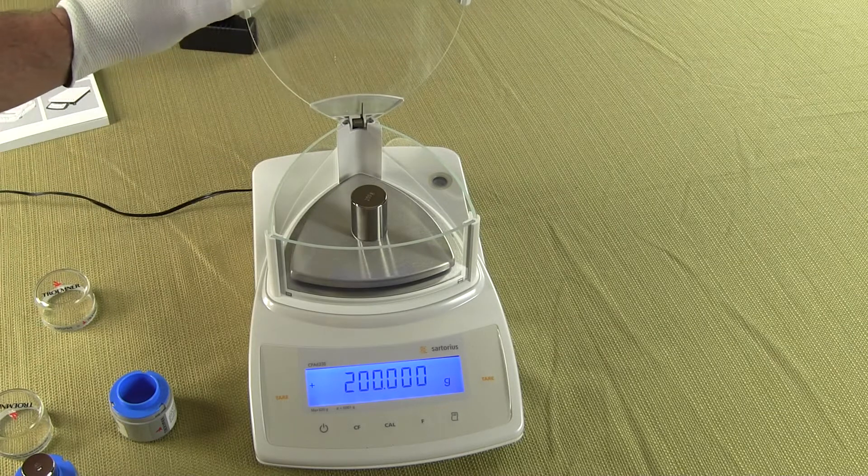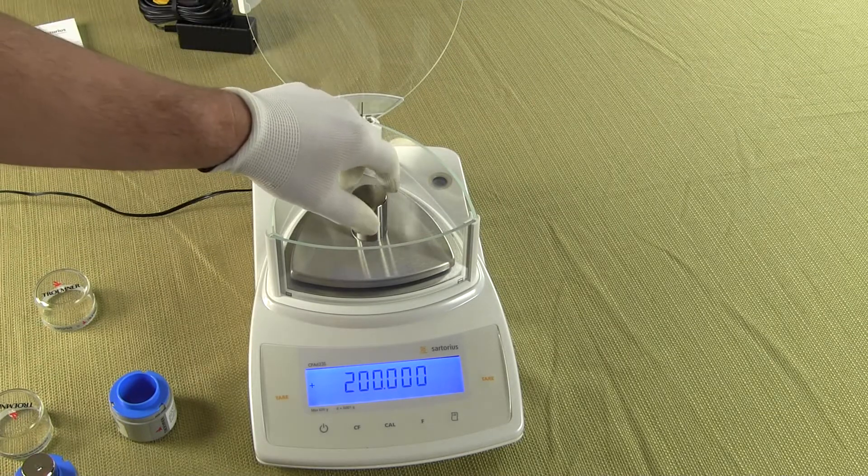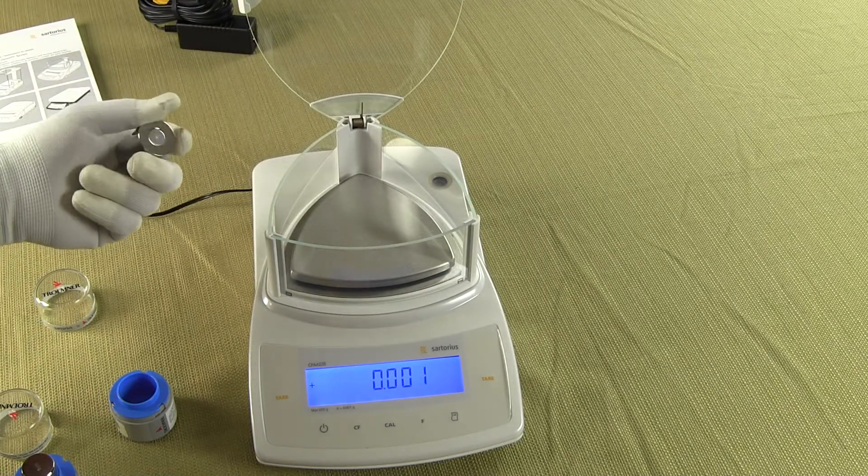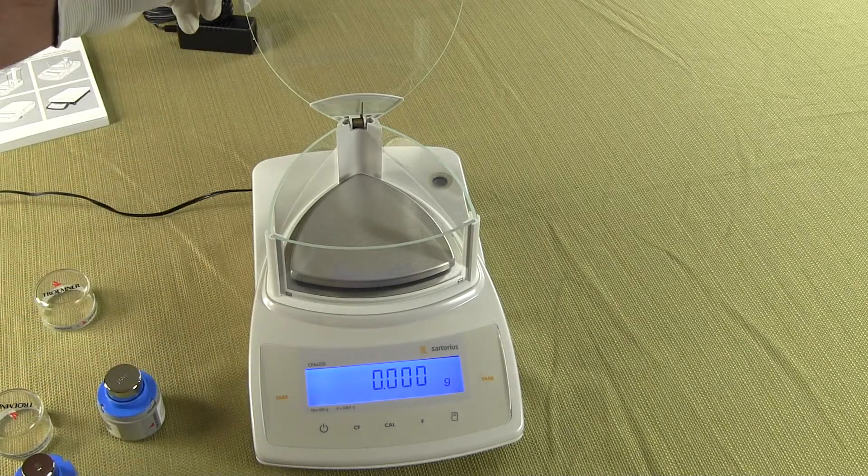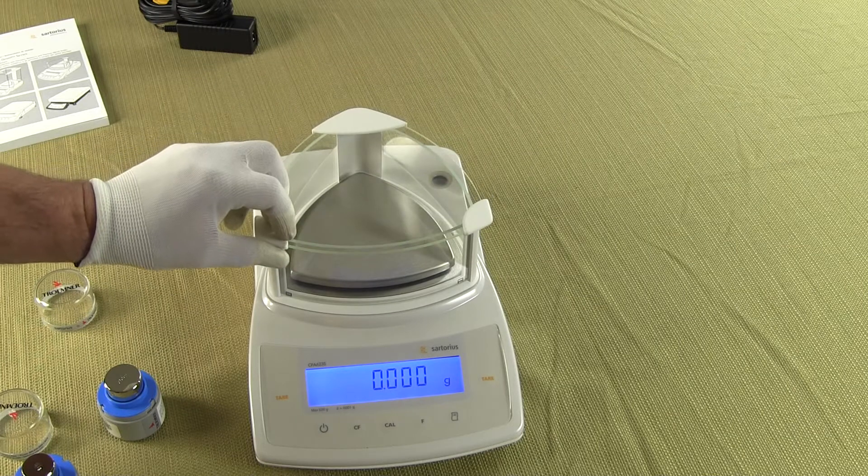And Sartorius even offers a function with this balance, we could match the internal calibration weight with an external weight if we wanted to. On this particular balance you would need a 500 gram weight to do so.